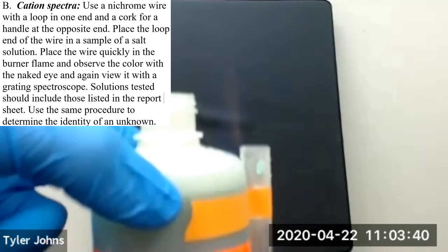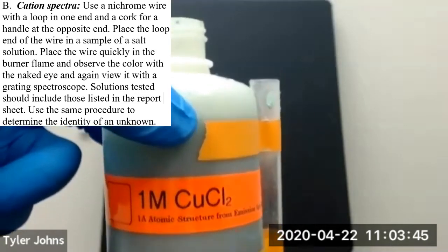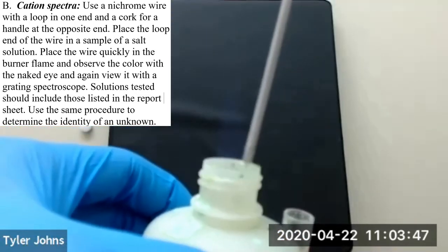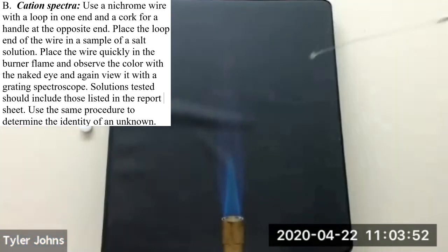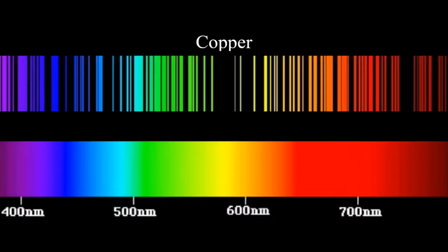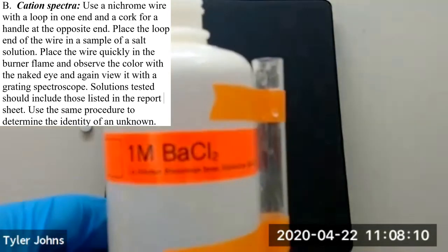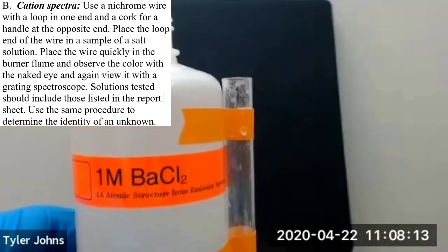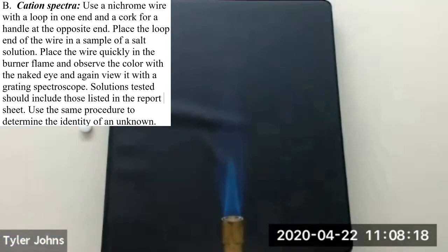The next cation spectra we'll be looking at is copper. So we'll take our copper chloride salt solution, insert our nichrome wire, and place it in the flame. The next cation spectra we'll be looking at is barium. So we'll take our barium chloride salt solution, insert our nichrome wire, and then we'll place it in the flame.